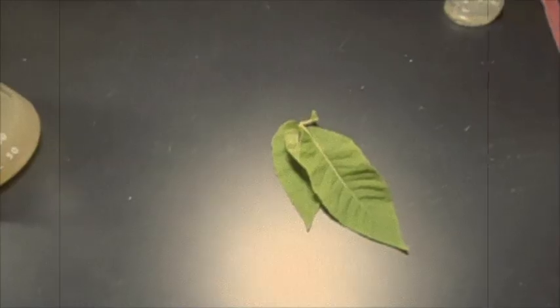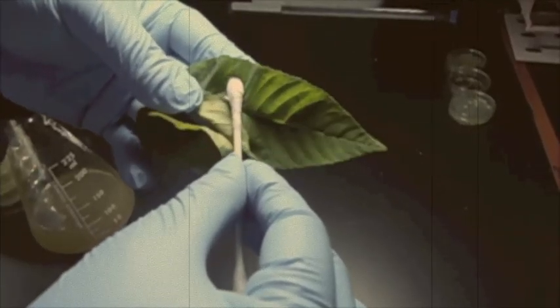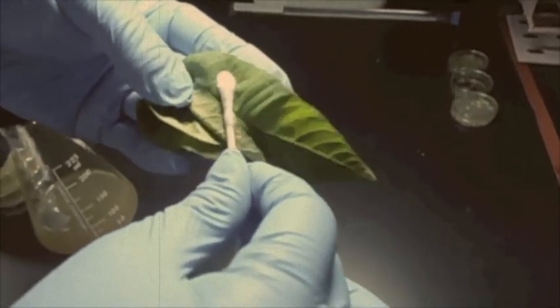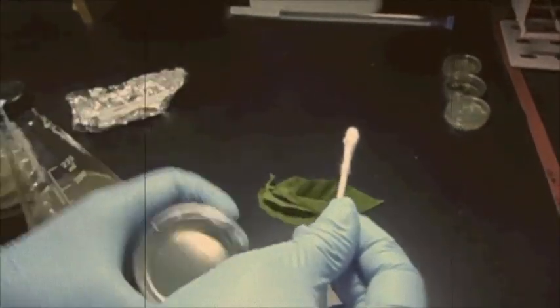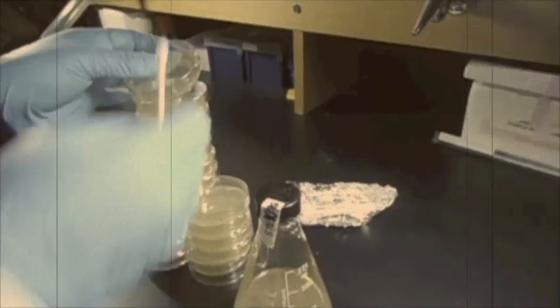For instance, if you would like to see what invisible organisms are growing on a tree leaf, start by swabbing the leaf with a sterilized Q-tip. Then swab the Q-tip gently on top of the solidified LB agar plate.